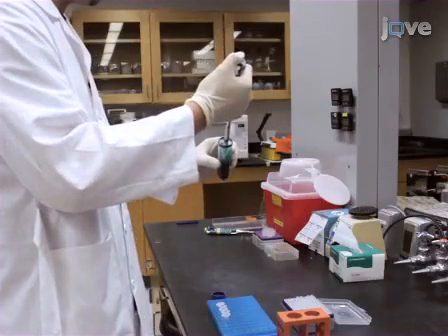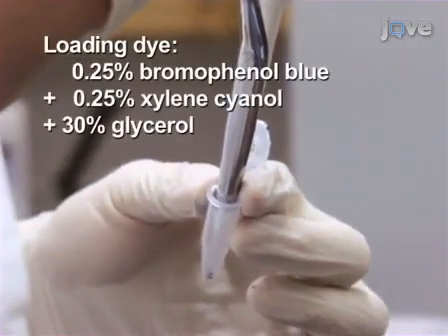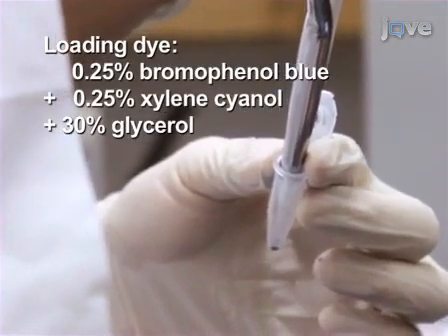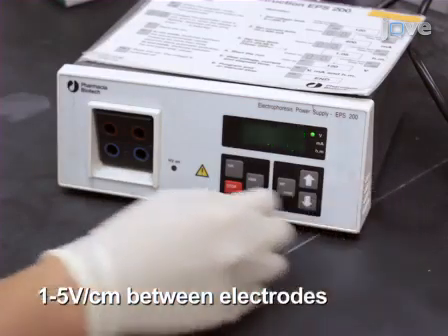To begin this procedure, add gel loading dye to the DNA samples to be separated. Loading dye is typically made at a 6x concentration. Program the power supply to the desired voltage.